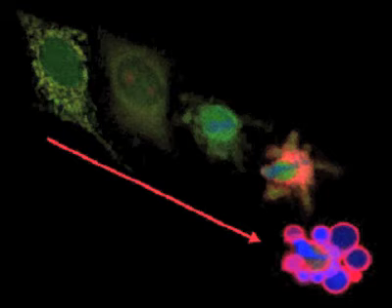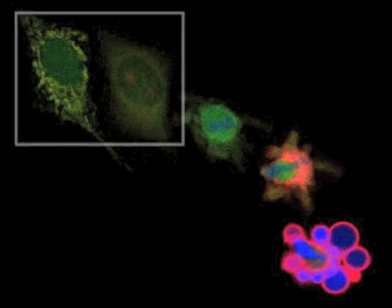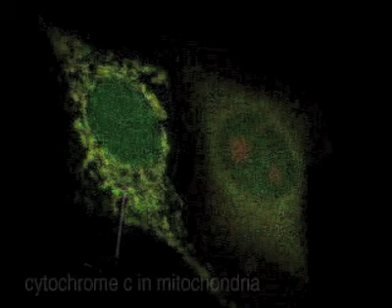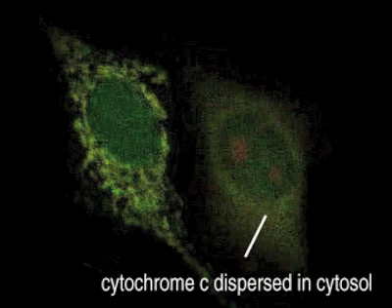The mechanism of apoptosis involves many tightly controlled steps, 3 of which are demonstrated here by different visualization techniques. One initial event is the sudden release of cytochrome C from mitochondria into the cytosol. This event has been visualized here using fluorescently labeled cytochrome C. Initially, the greenish-yellow staining is restricted to a reticular pattern, which then suddenly disperses as the mitochondria release their content proteins into the cytosol.